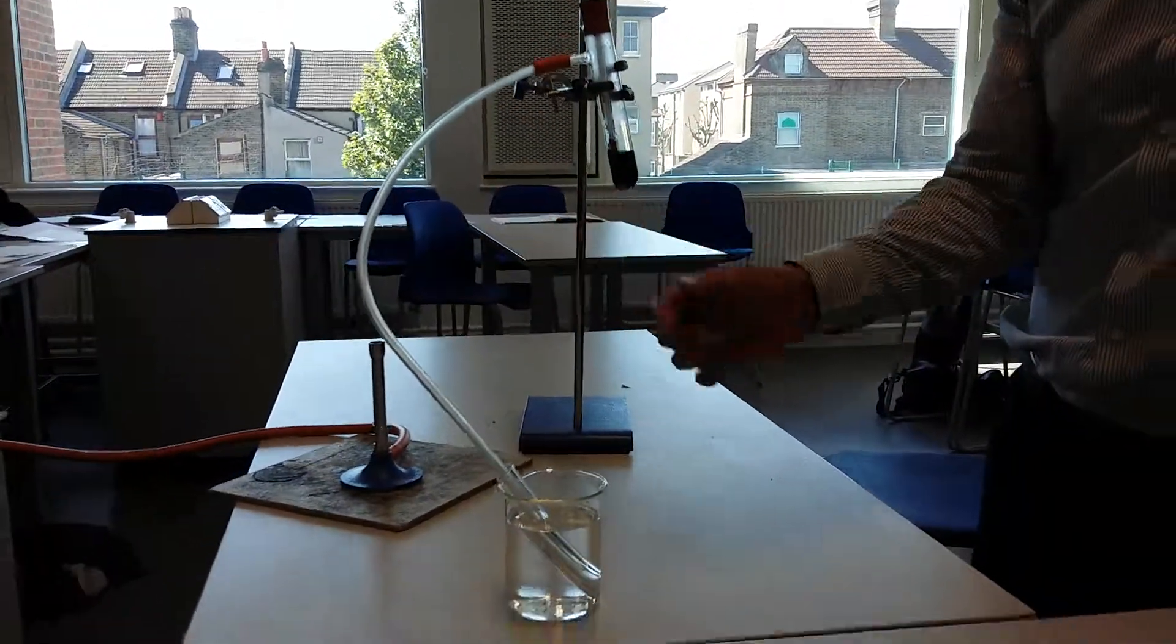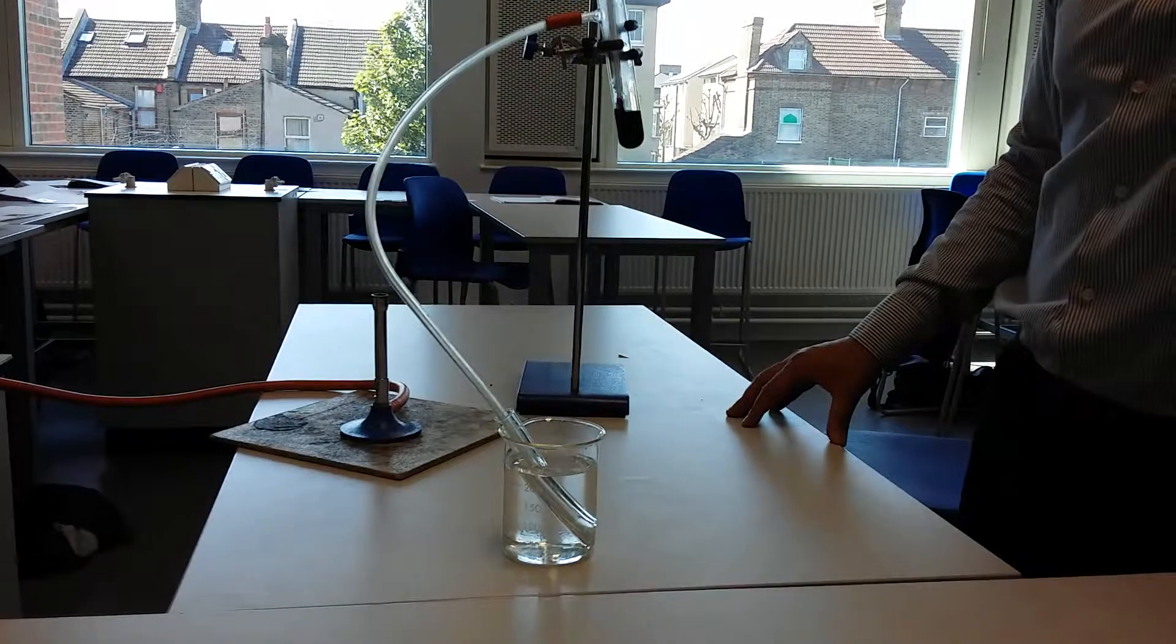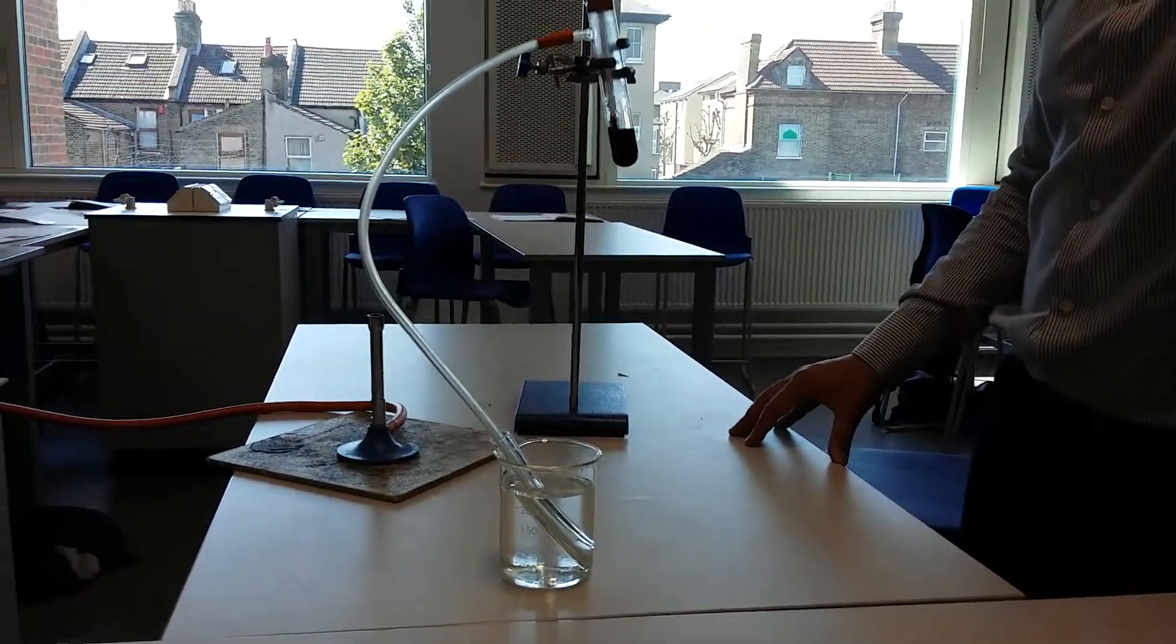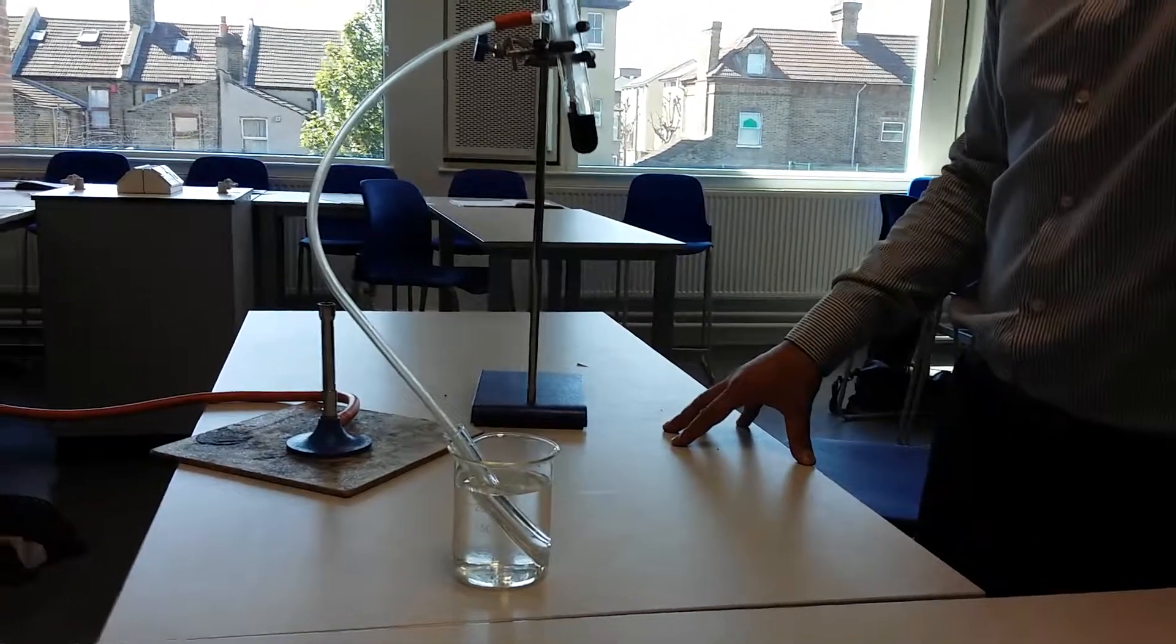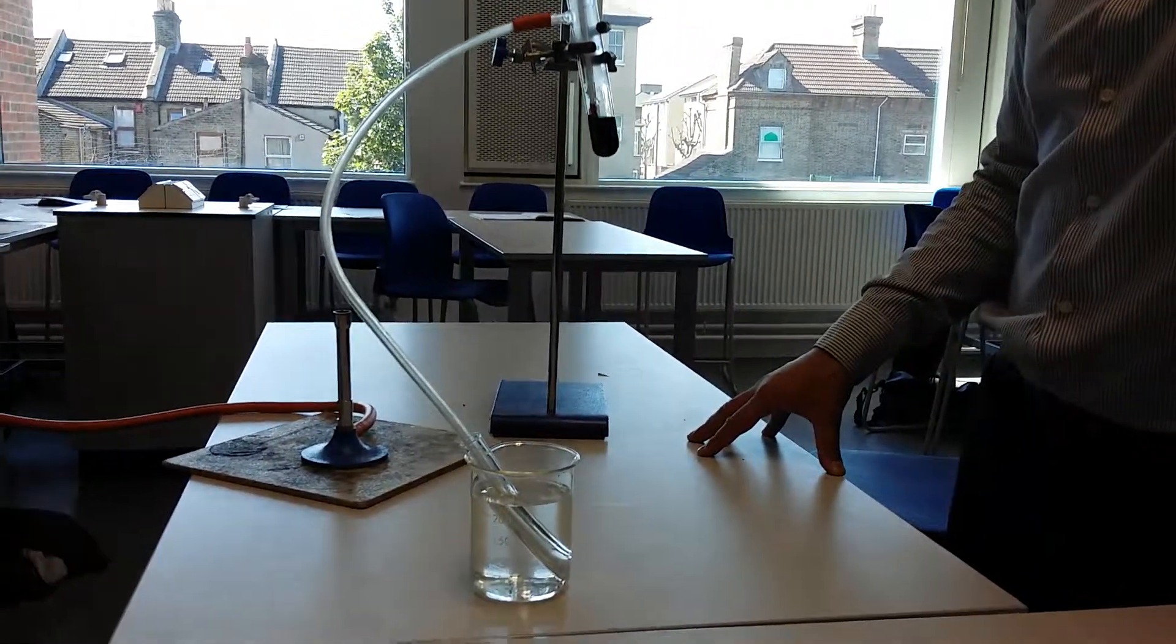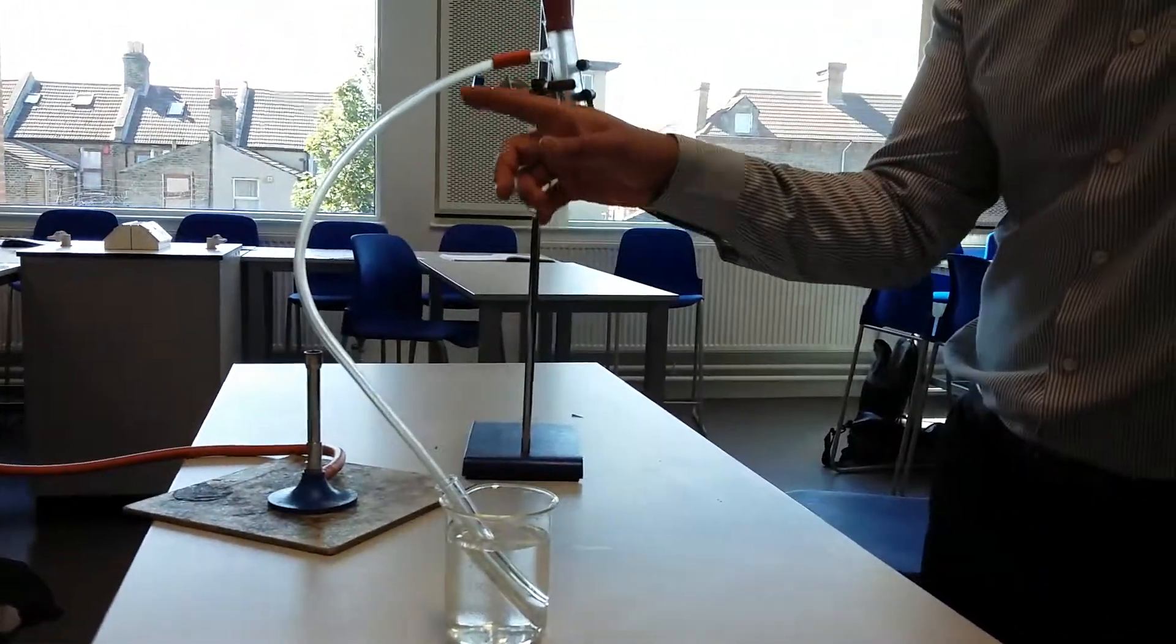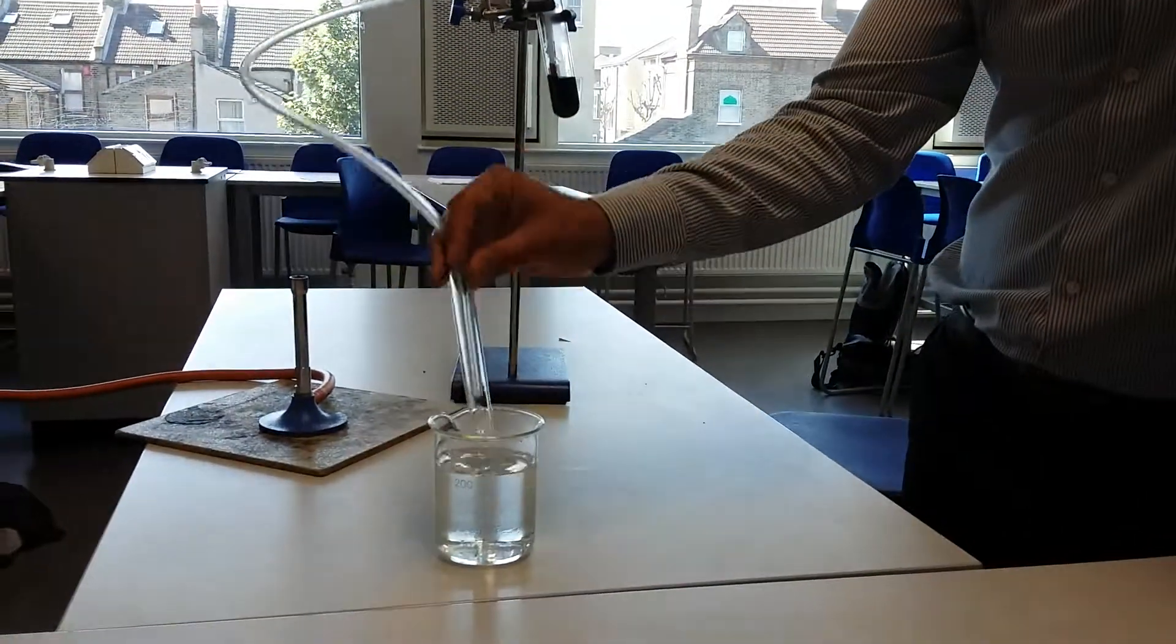Rashaan, what do you think is going to happen to it as it goes through this? It's going to condense. Condense, fantastic. What does condense mean? When the gas is cooled down. Cool down and become a liquid. Fantastic. So it's going to cool down to become a liquid and it's going to go on and collect in here.